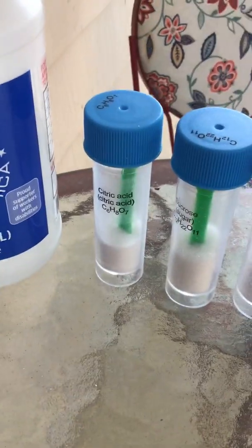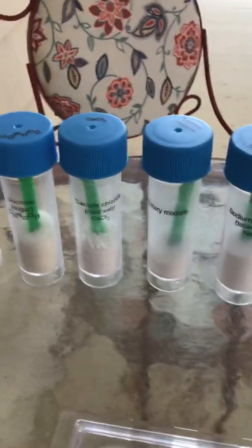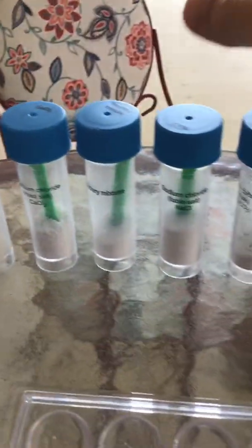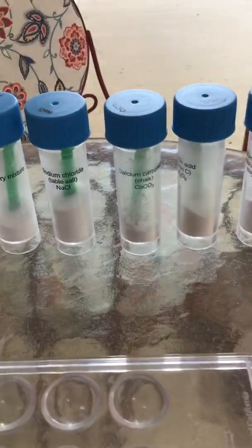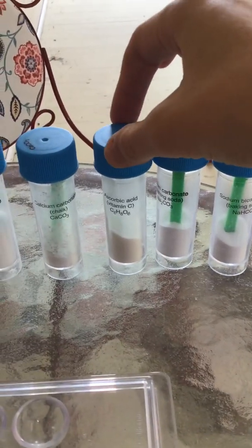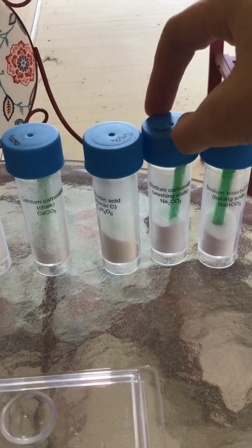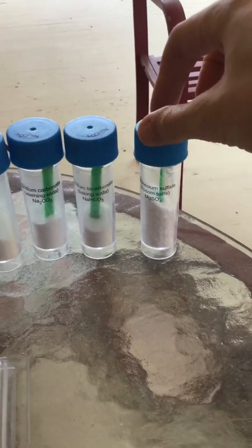We have citric acid, sucrose, calcium chloride, the mystery mixture, sodium chloride, calcium carbonate, ascorbic acid, sodium carbonate, sodium bicarbonate, and magnesium sulfate.